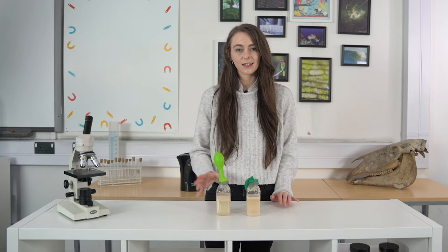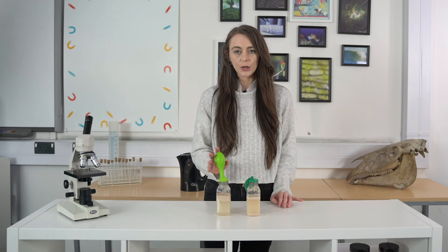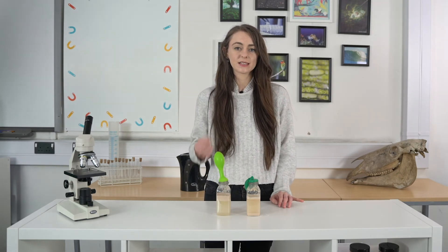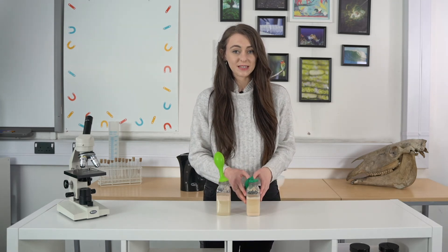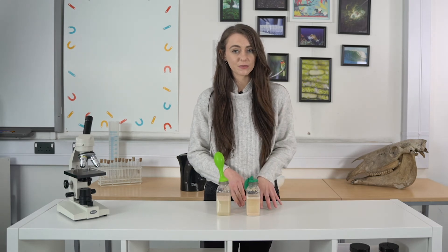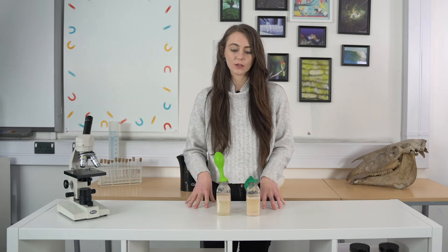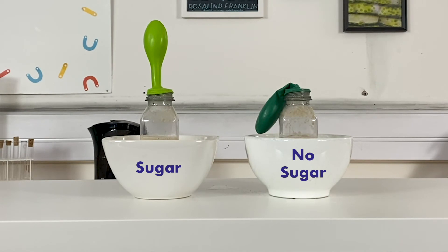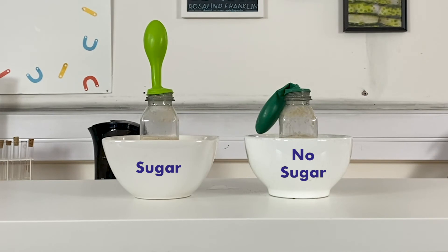So I'm stopping my experiment now. As you can see, the bottle that had sugar as fuel for its respiration respired a lot faster — the balloon has blown up because it released carbon dioxide. The one where sugar was a limiting factor, however, the reaction didn't happen anywhere near as fast, and so the balloon hasn't blown up. If we'd left this go on for longer, eventually it would have blown up. But clearly, without one of its resources, the reaction times differ — it affects how quickly they can respire.